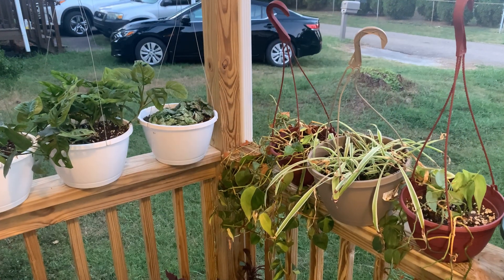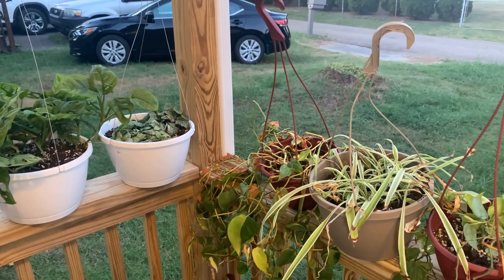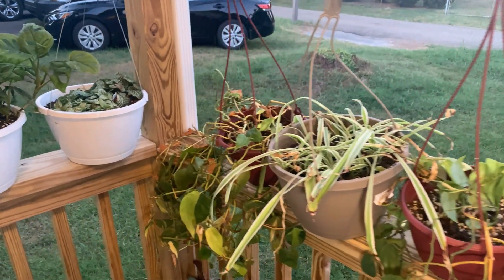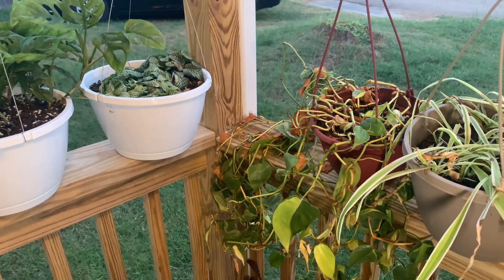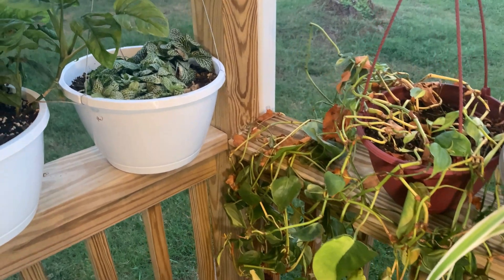What is going on guys, welcome back to another sterilization video. It has been a long time since I've done one of these, and today I'm working with some vining philodendrons. Let me show you. This is the second time I'm recording this, so the lighting is a little low now because it's getting late at night, but I'm working with some vining philodendrons — for example, I have this Philodendron Brazil.